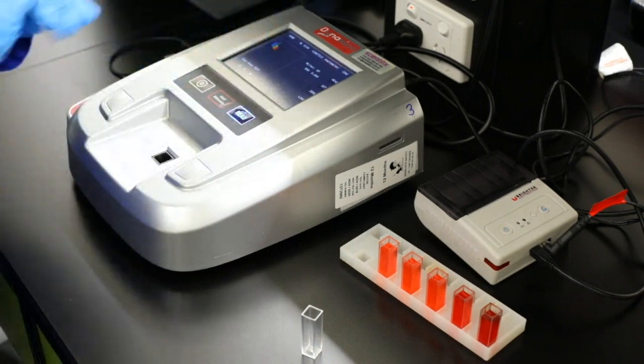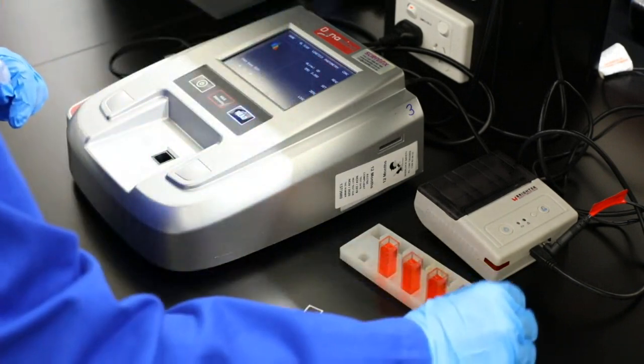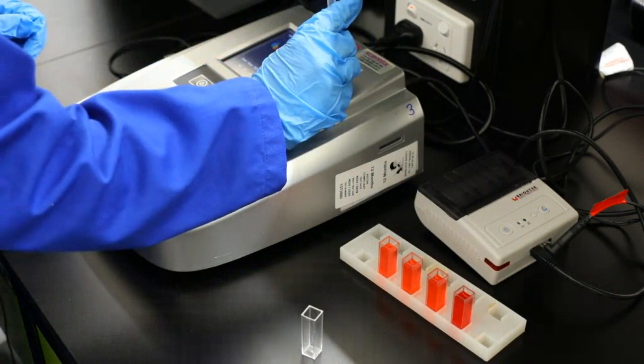And depending on what setting, the machine can do a calibration curve, or you can make your own. So I'm going to do the really bright colour red one here. We're going to do a run, so we're going to read this one.